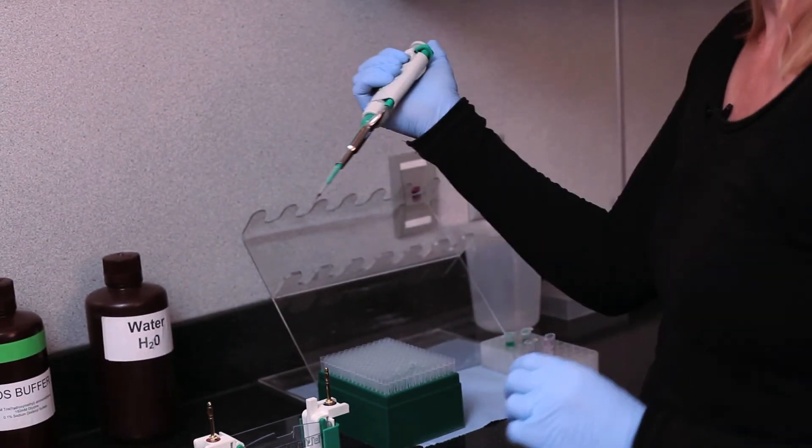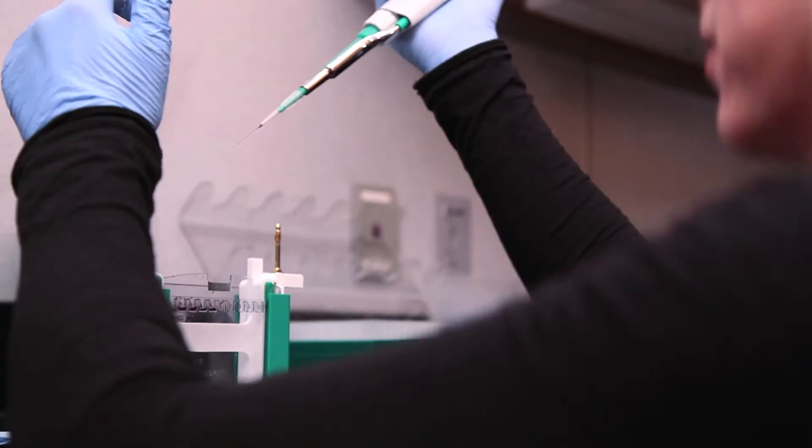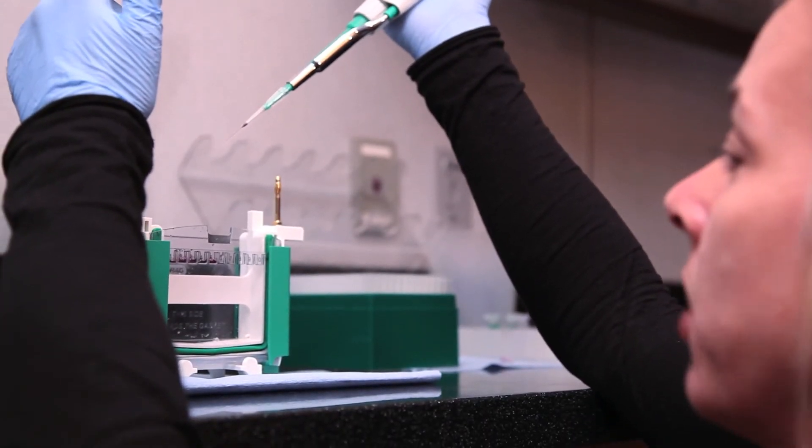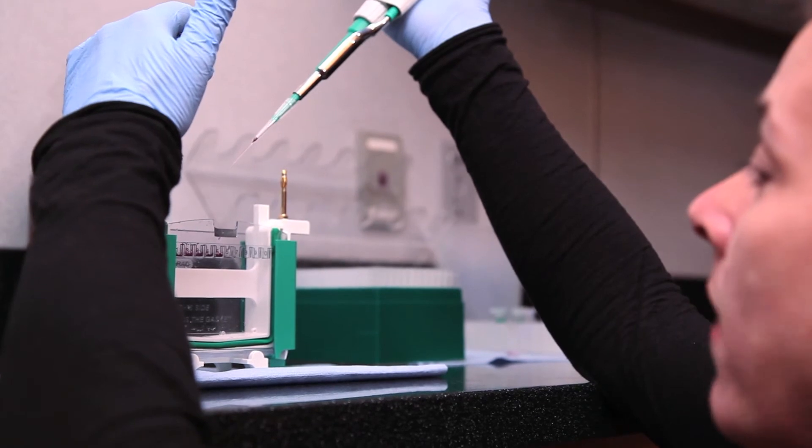So now I'm going to prepare to load my sample onto my gel. I'm going to kneel down to be at eye level with the wells of the gel. I'm going to anchor my arms on the countertops to provide steadiness.